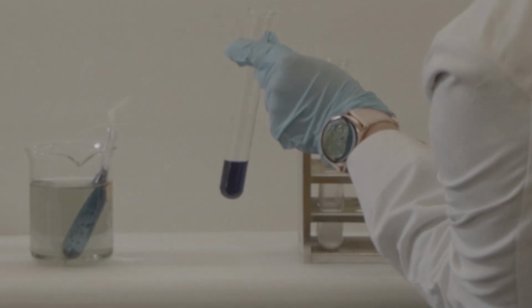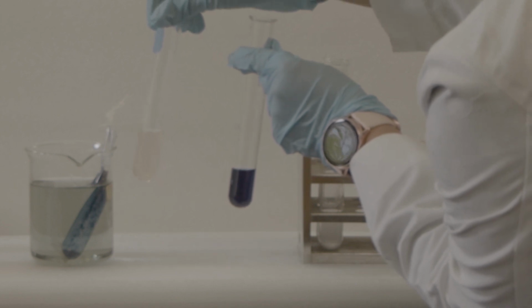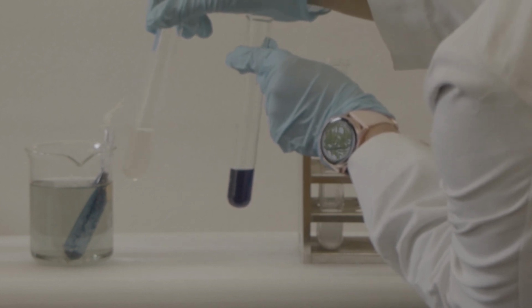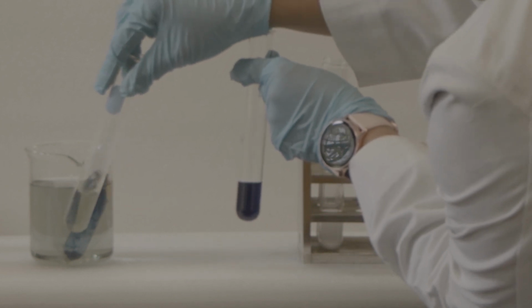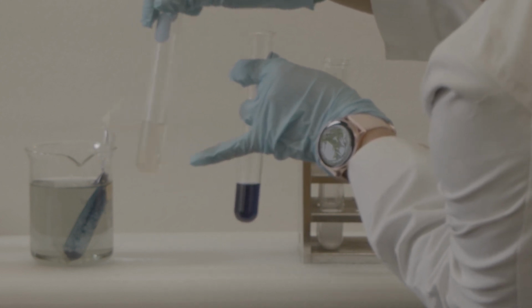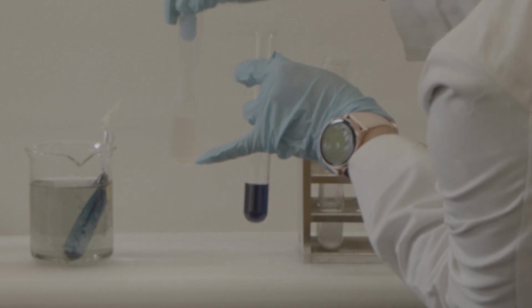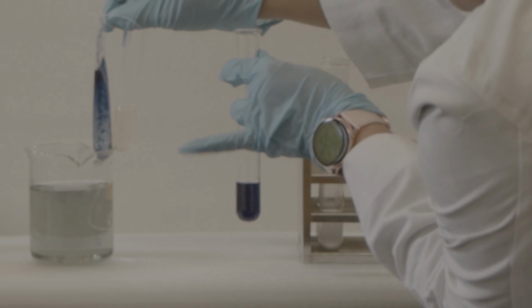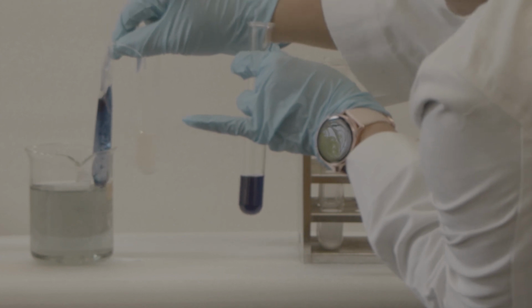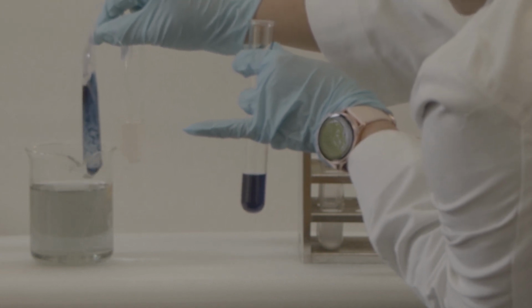But what happened when we did the hot bath, right? This is when I did the hot bath, and my barium and chloride ions came outside the jar, but the starch did not. So that result is this one. The starch did not come out from the dialysis bag, but when I put the iodine, it passes through. So what the dialysis bag does is, only the true solution, with particles less than 1 nanometer in size, can pass through this dialysis bag.